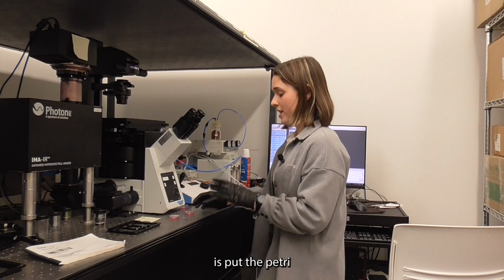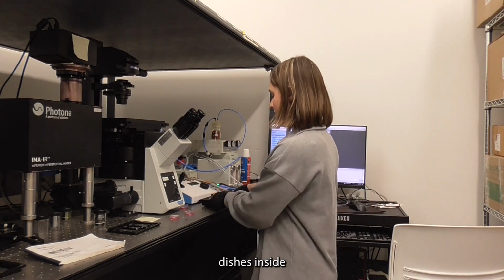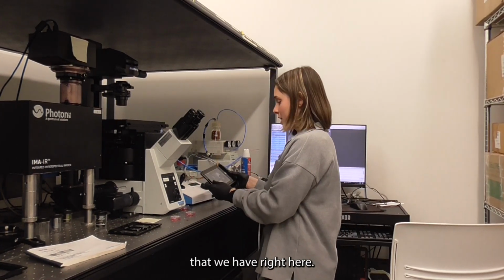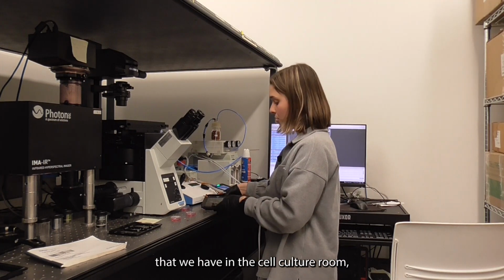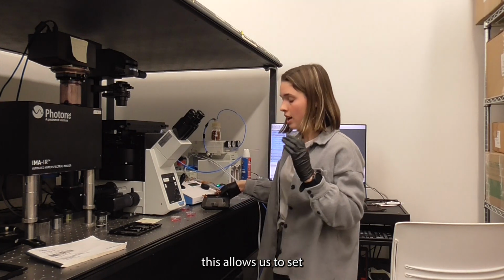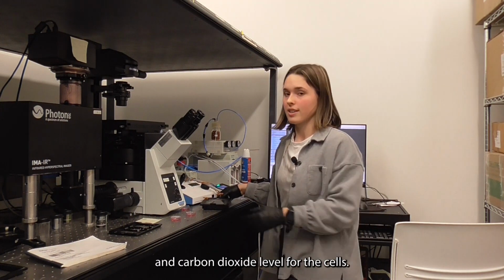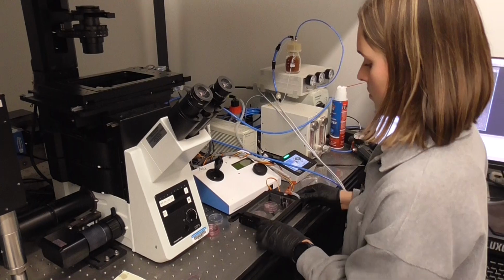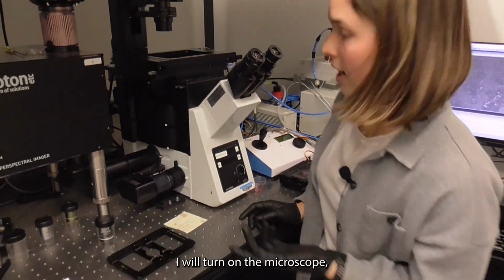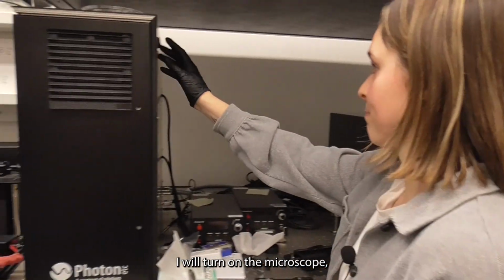First thing I'm going to do is put the petri dishes inside a little stage incubator that we have right here. Just like our big incubator that we have in the cell culture room, this allows us to set a certain temperature and carbon dioxide level for the cells. Now that that's all set, I will turn on the microscope.